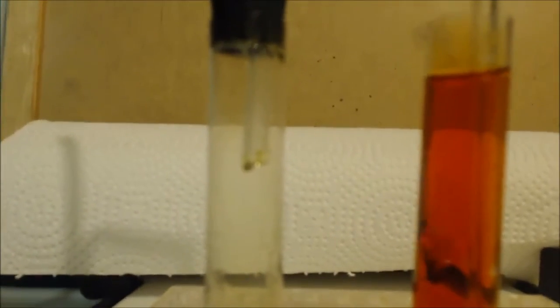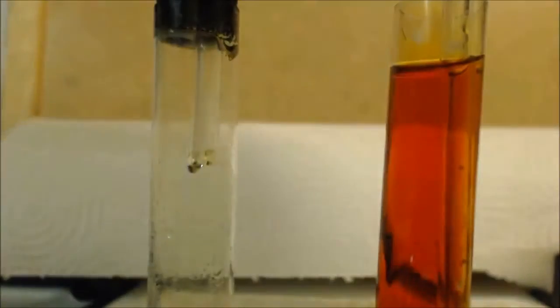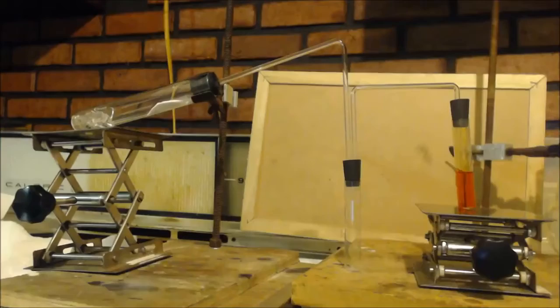See that right on top? If you need to see it bubbling through or not. I'll just let that finish up. You can see my point. This is the last thing. I got some ethanol again in here, but I put some chunked up glass in there. I don't have any cotton or anything, but usually I'd put cotton or something in there. I don't have any, and I don't have a car right now.